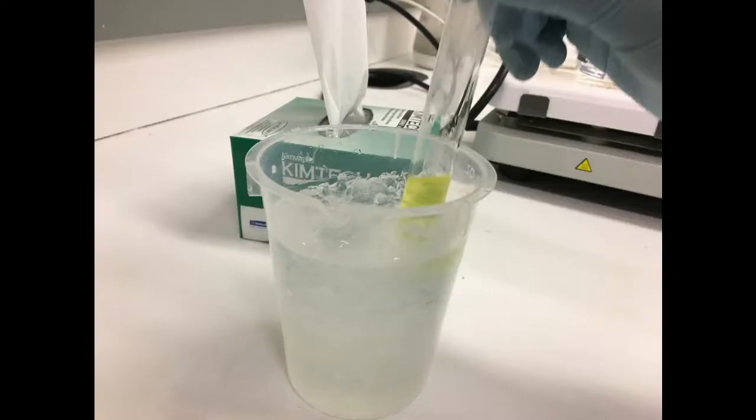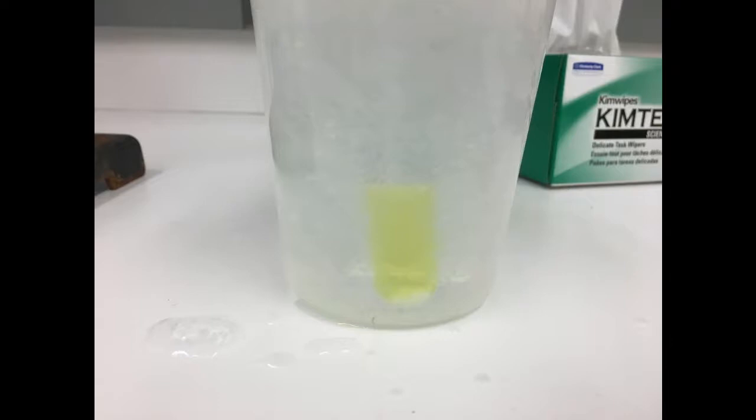Once the filtering is done, take the test tube with the filtered contents in it and place it in an ice bath. Make sure that none of the ice bath water enters the test tube. Carefully watch the test tube for any signs of crystal formations.